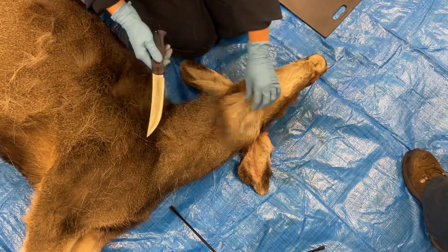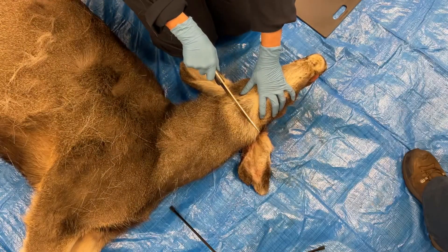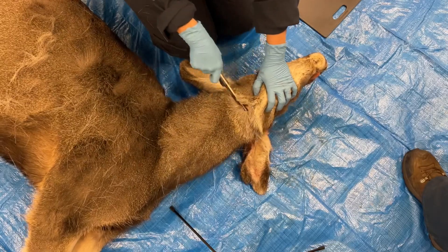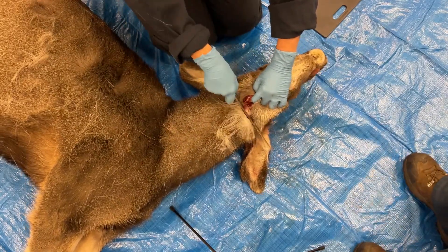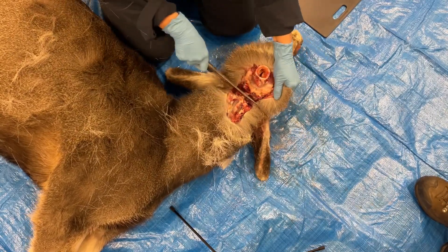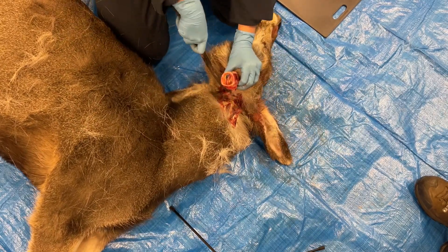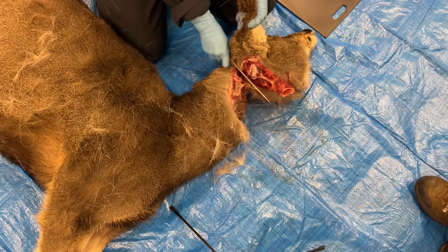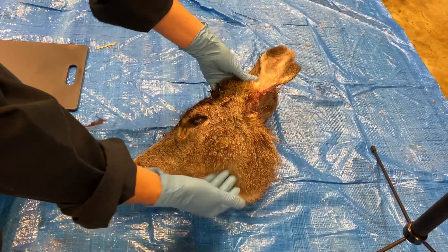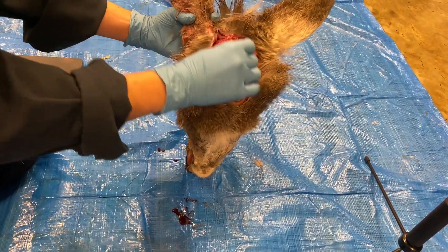As you see here, you're cutting just below the larynx up towards the back of the ears, being careful not to cut any of the tissues of interest. Now the head has been successfully removed — the front of the neck is still intact and all of the tissues needed for testing are present.